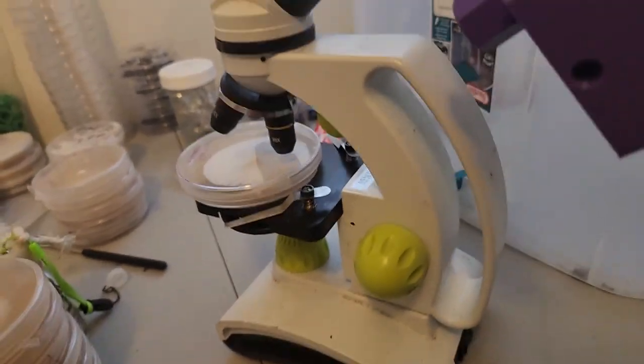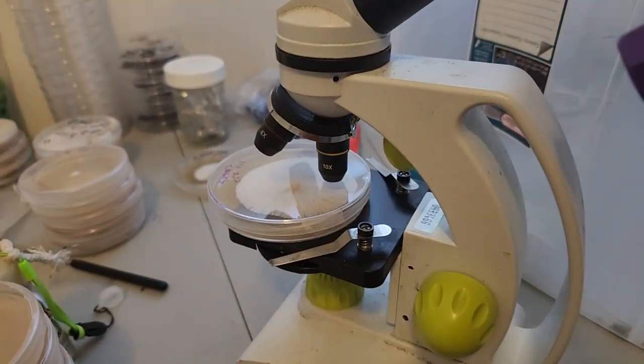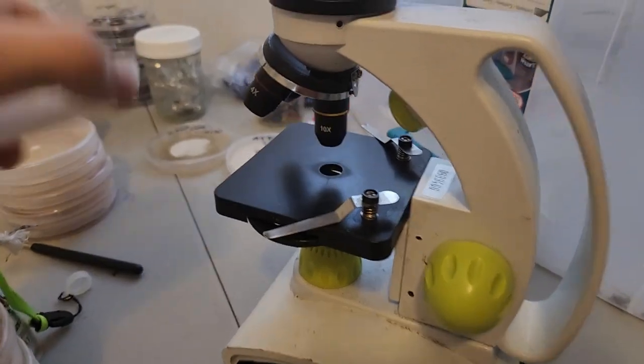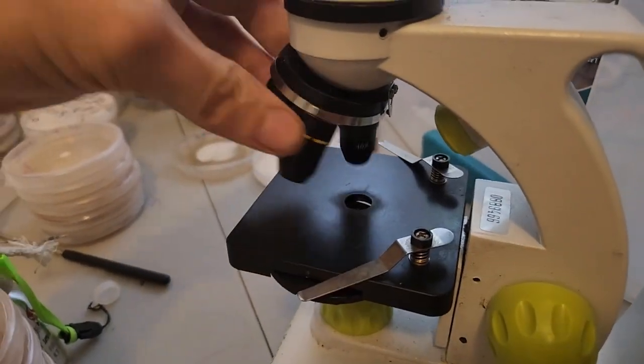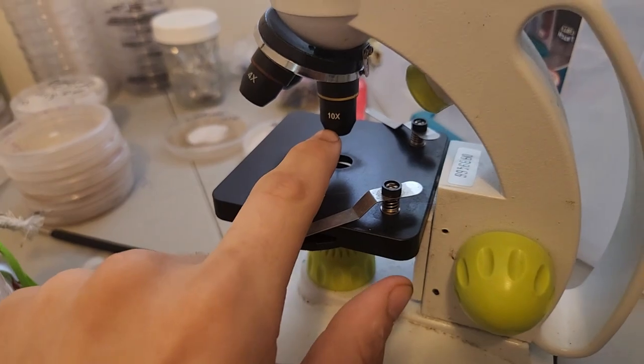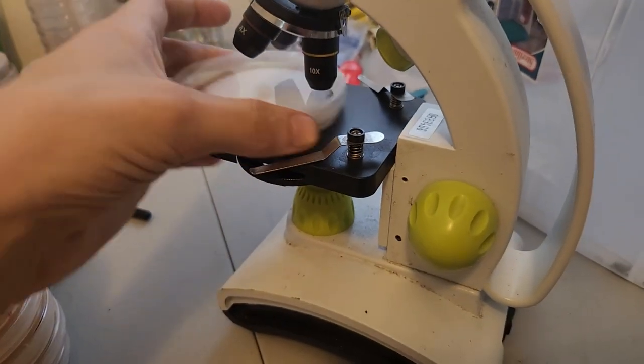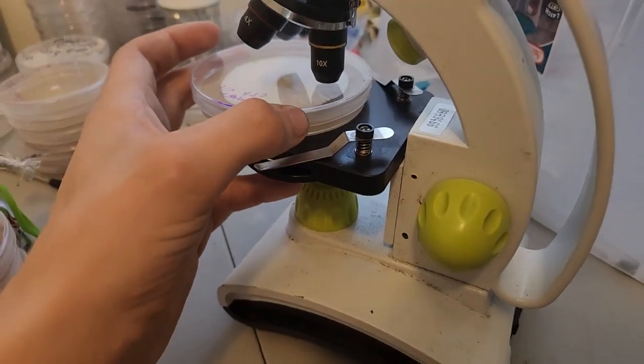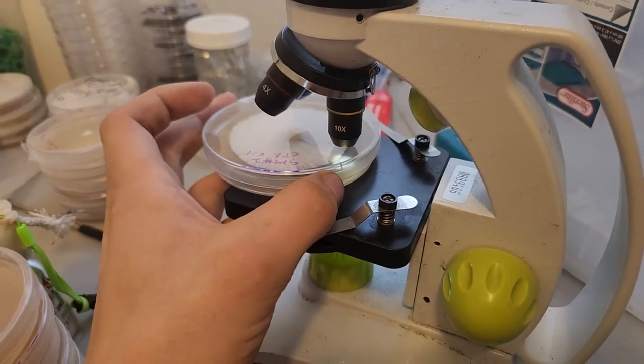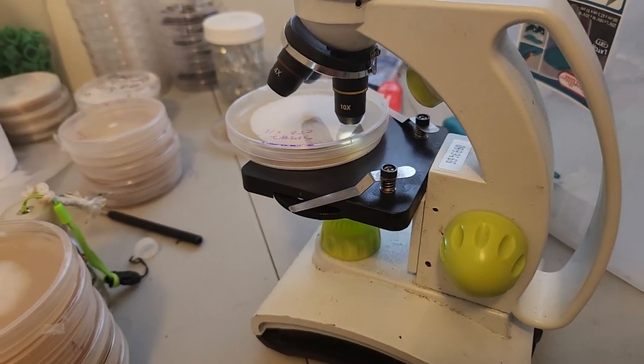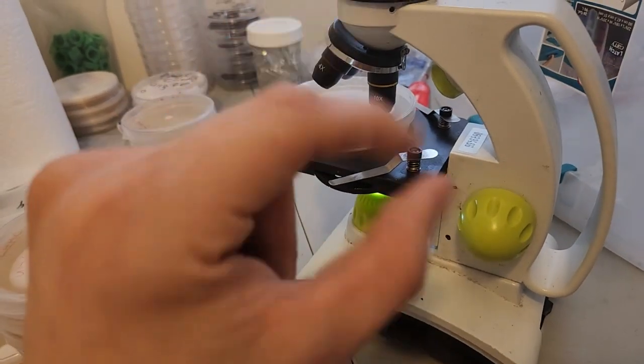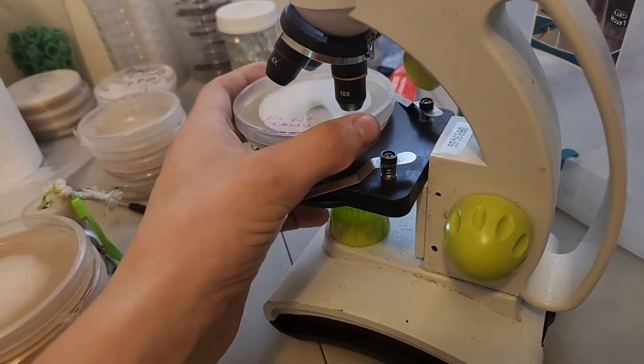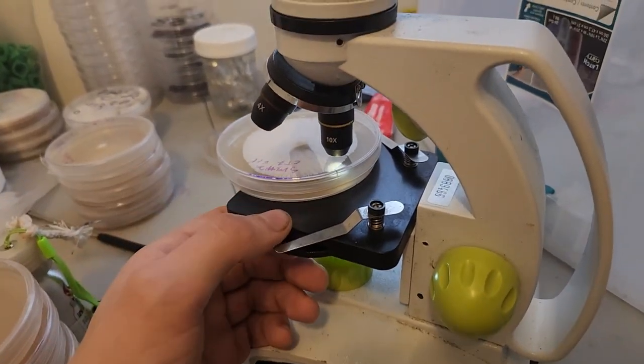And for this setup, you don't need a fancy microscope. I've had this one since middle school. It goes up to 400x, but what I do is I keep it on 100x. This is 10x magnification and a 10x optic. And what I do is I just stick it on there with the light, and then I put my phone in telephoto mode. I use the zoom on my phone to increase it to like 1000x, and then I can see the hyphae really clearly.